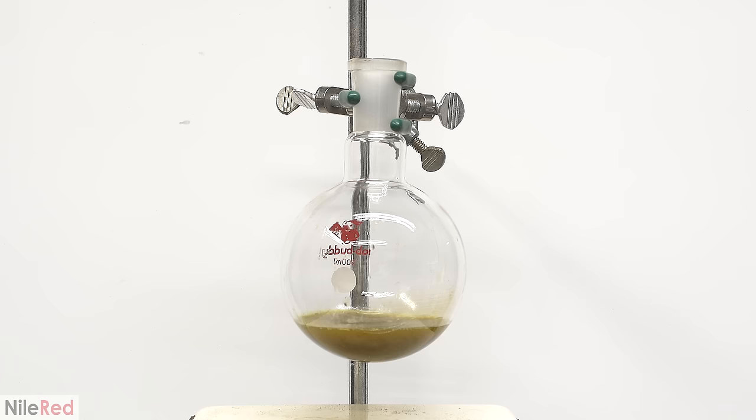I left it overnight in the fridge and this is what I had in the morning. The crystals were separated on a coffee filter and they were washed with a very small amount of ice cold isopropyl alcohol. The filter was removed and the isopropanol was allowed to evaporate. After about a day or so, I was left with some nice and dry piperine crystals.